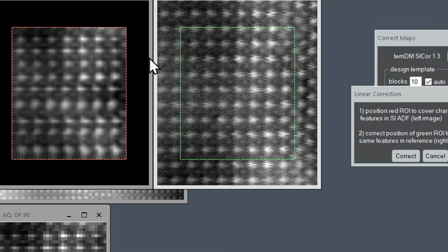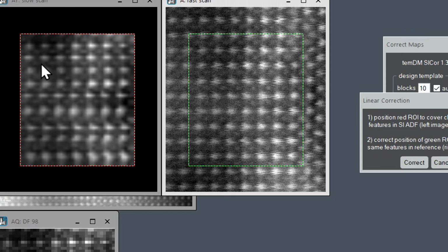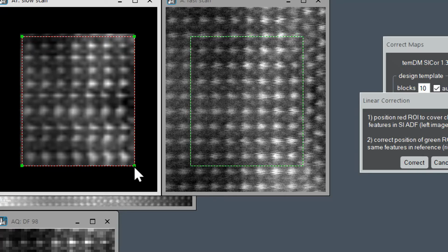On the left, we see the heavily distorted dark field image, and on the right, we see the reference. There are also two rectangles, red and green, and our task would be to position these rectangles such that they cover exactly the same area in both images. We can move rectangles by dragging their corners. It's actually sufficient to move only two corners, for instance, left upper and right lower.